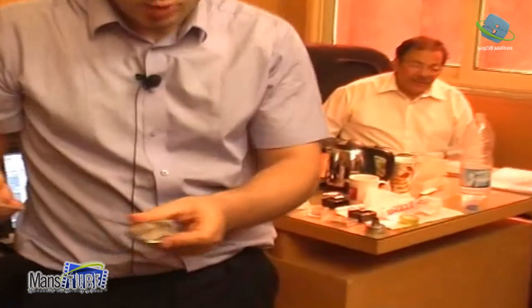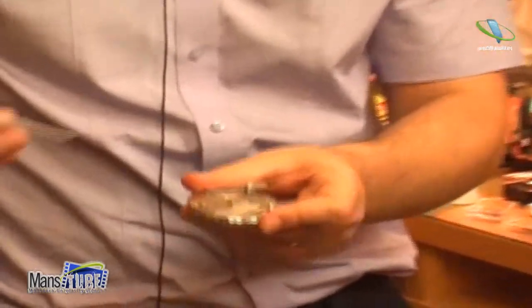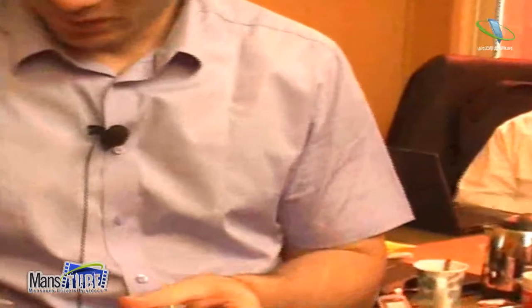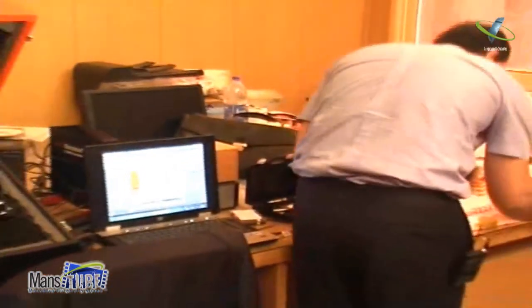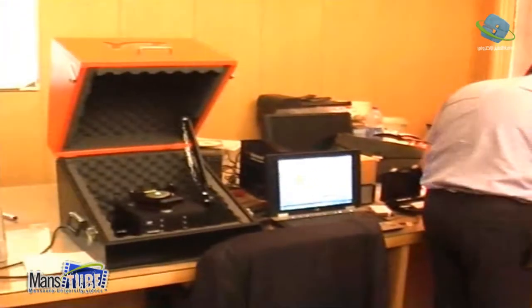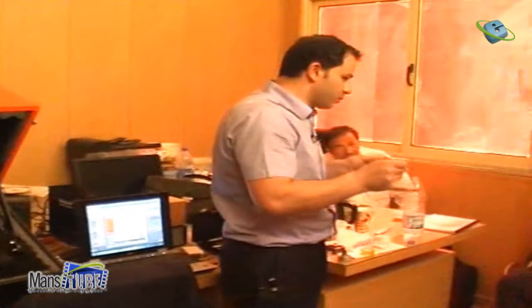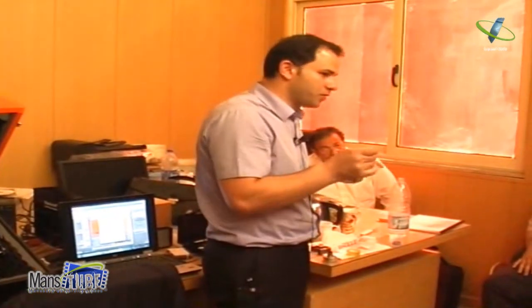It doesn't drop, okay? Because it's just one droplet of liquid. It is water, so one droplet of water. If you put too much more, of course, it will go out. Yeah. Okay? So, this is, you see? Okay, it's already clean. Okay, for now. But if you work in real clean conditions, then you need everything to be perfect.